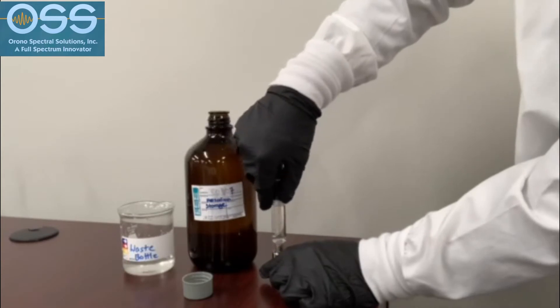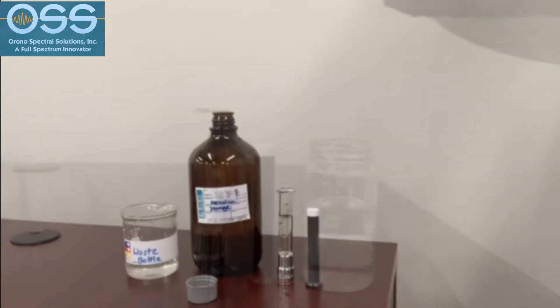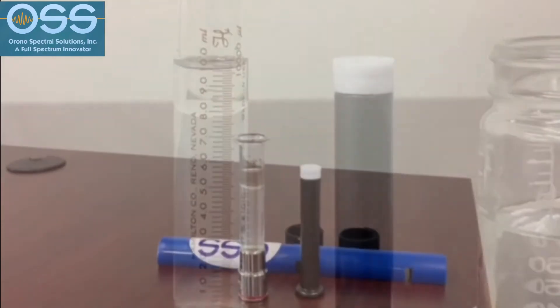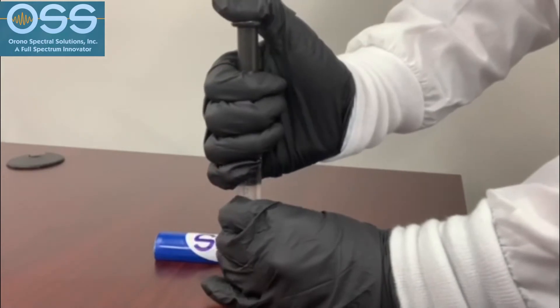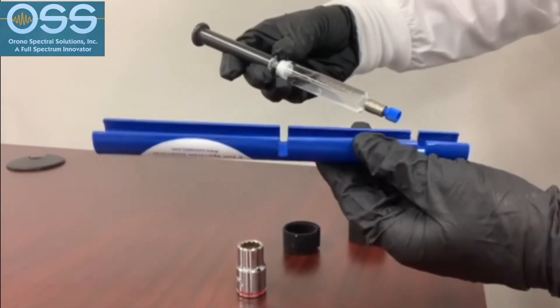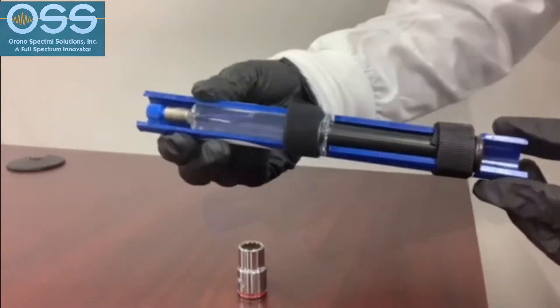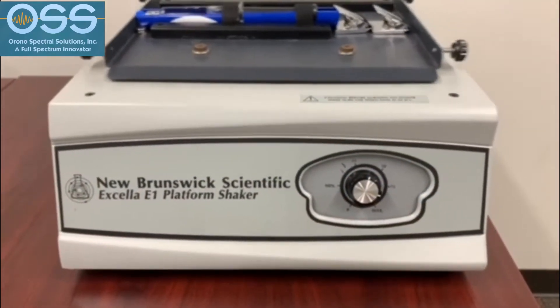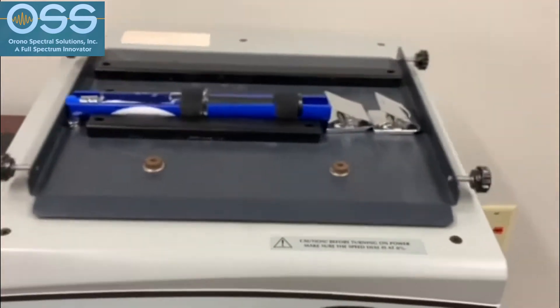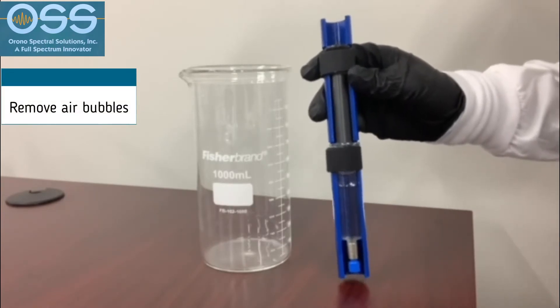The next step is to position the syringe in a holder and then remove the plunger. Add 2 milliliters of N-hexane into the syringe. The solvent will remain on top in a separate layer. Then reinsert the plunger into the syringe. Place and secure the syringe into the syringe holder using the 2 Velcro straps. The solvent will extract all the oils from the sample while on the shaker for 20 minutes.